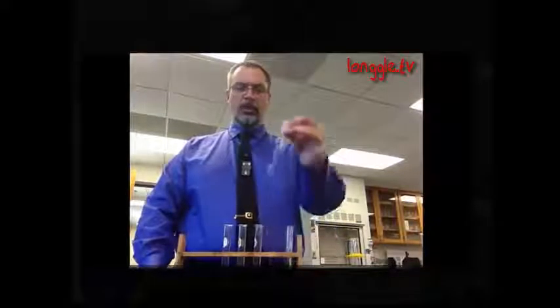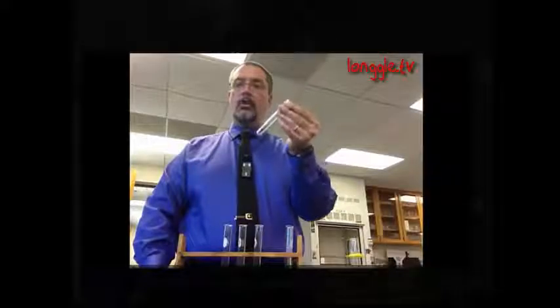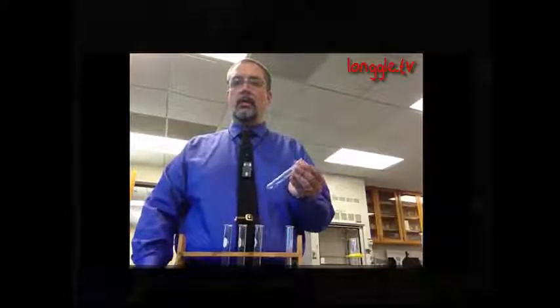The test tubes are where we do small reactions. We do chemical reactions in test tubes all the time. Tests. Test is just another word for reaction often in chemistry.